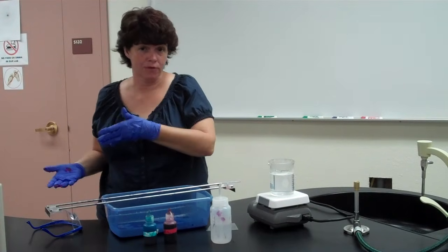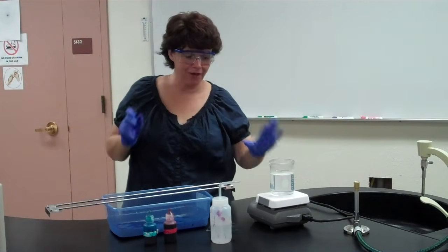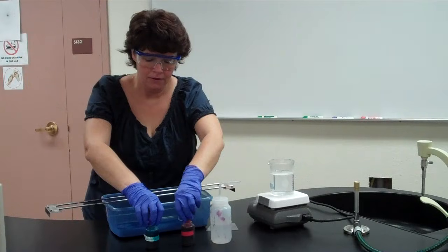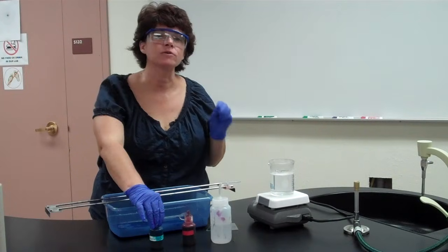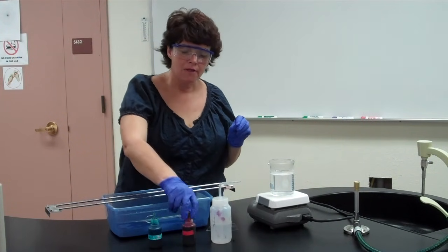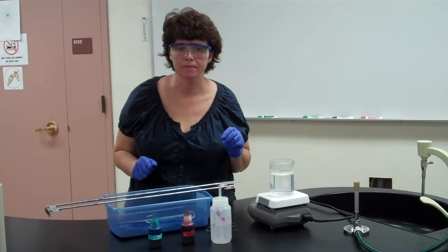Then you can start going further in the classification. The endospore stain is similar to the acid-fast stain in the fact that we're going to use heat. The difference is there's only the first stain and the second stain. The primary stain in this case is not staining the outside wall of the bacteria, it's actually staining the endospores. Then your counter stain will stain the wall of the bacteria. There's no decolorizing step, okay?